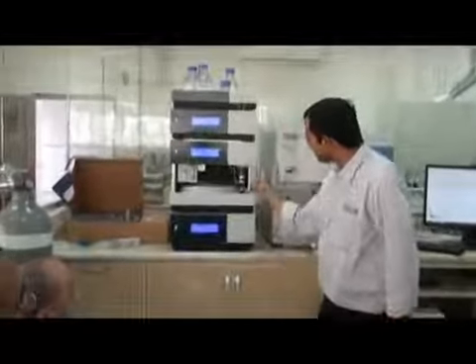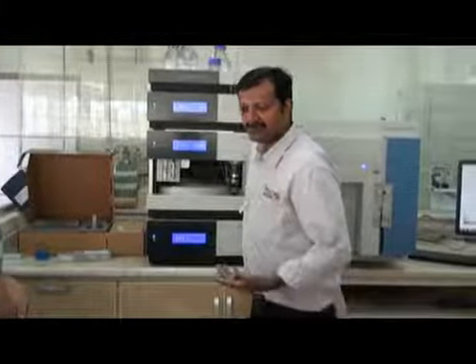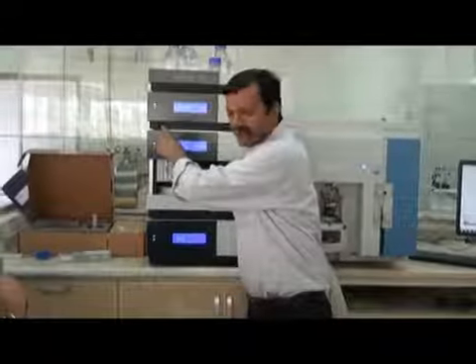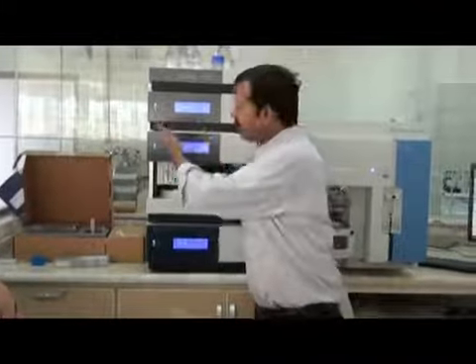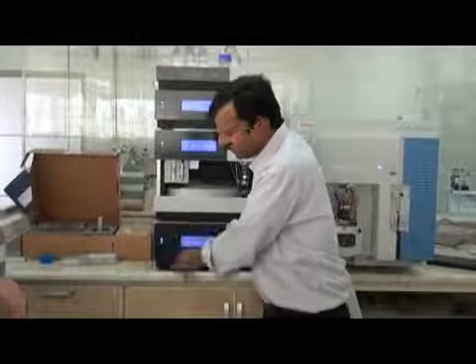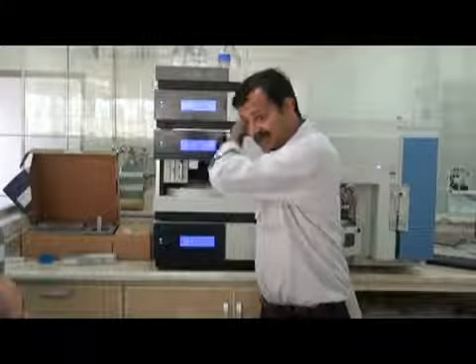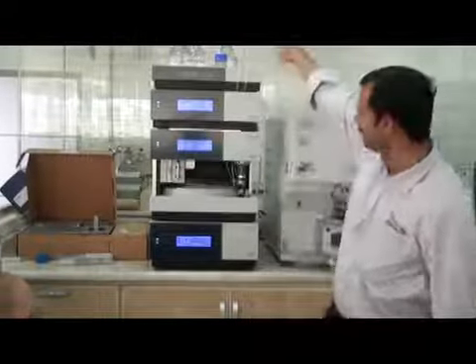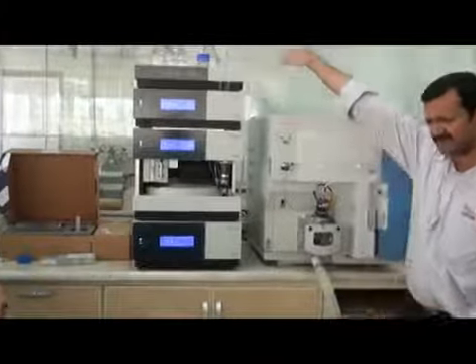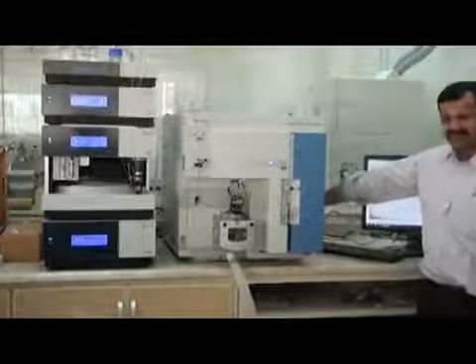Okay. So your LC has the main mechanical switch behind here. This is the power switch. And this is one more electronic switch here. You can switch on from here directly, no problem, or if you want, you can switch on from this. But this will work only if the mechanical switch behind is on. If that switch is off, this will not work. So behind there is a mechanical switch, it's not a big deal. For the MS, we have a few switches here.